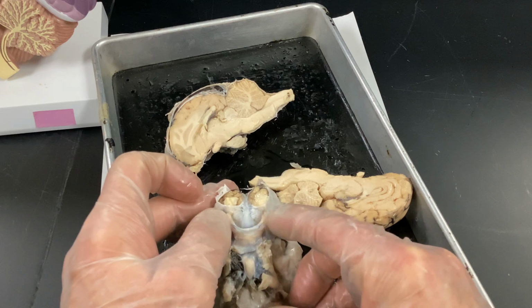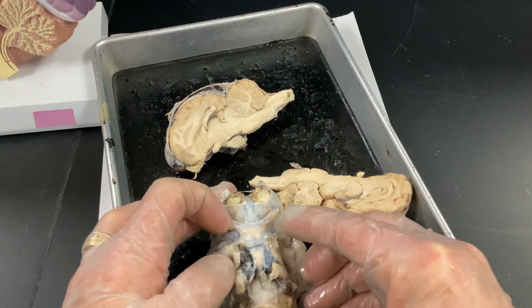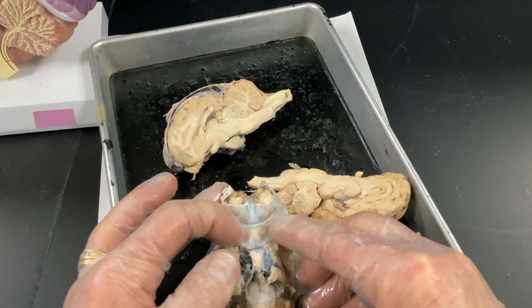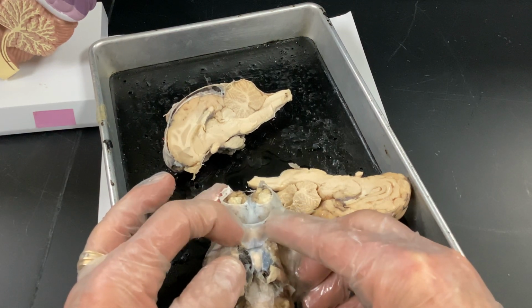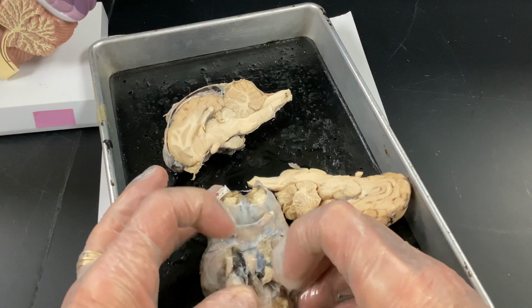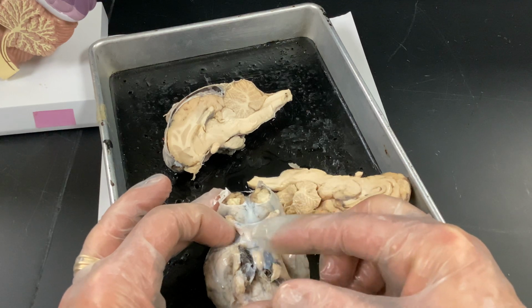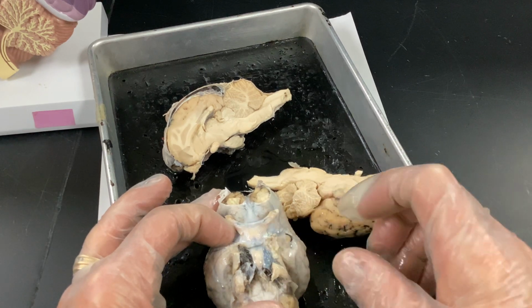And these right here, cranial nerve 2. That's your optic chiasm where they cross over. Remember, the lateral part of the visual field stays ipsilateral. The medial is contralateral, crosses over. And we're going to see in the model, and I don't know if I'm going to have time to dissect or pull all this off, but maybe I can show you in the sagittal cut.